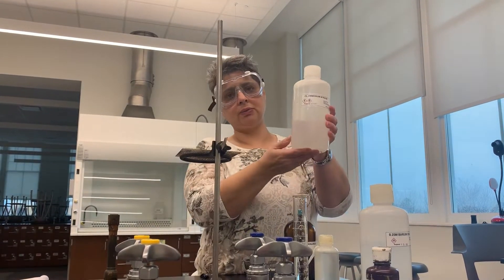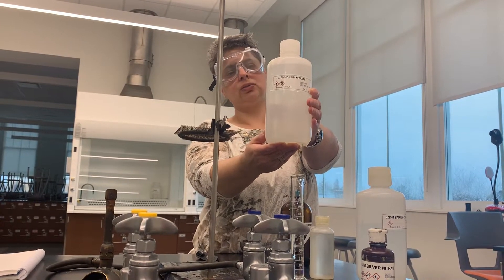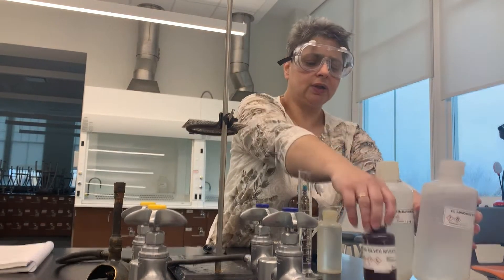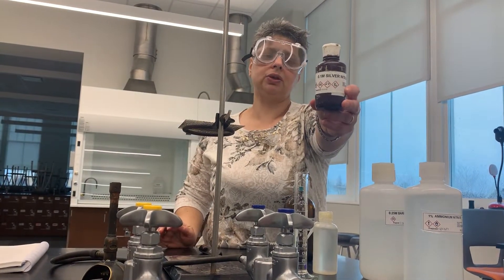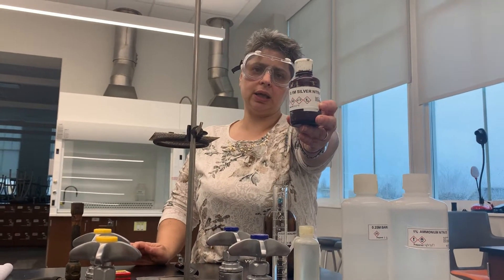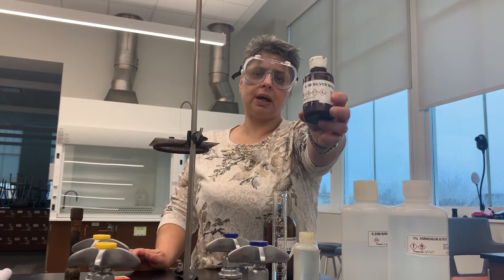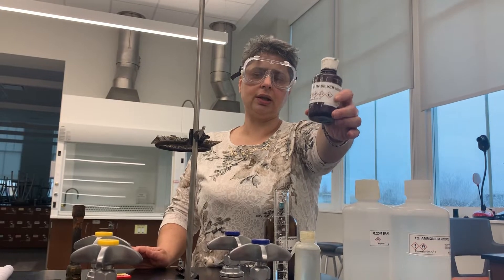This right here is 1% ammonium nitrate solution, NH₄NO₃. This is what we're going to use later to wash our barium sulfate precipitate. And finally, this in the small brown bottle is silver nitrate, which may be familiar from a previous lab. Silver nitrate will be used to test for any chloride ions present in our precipitate, but I will come back to this in a later video.